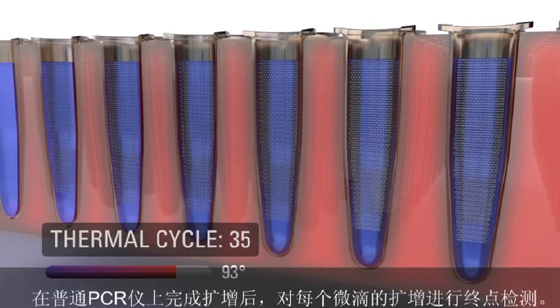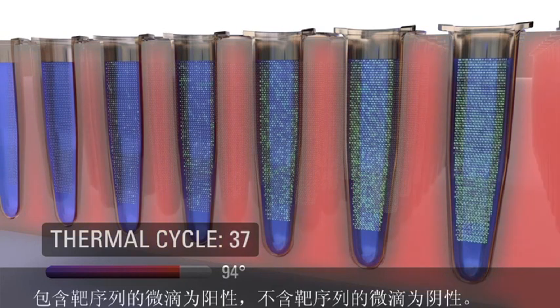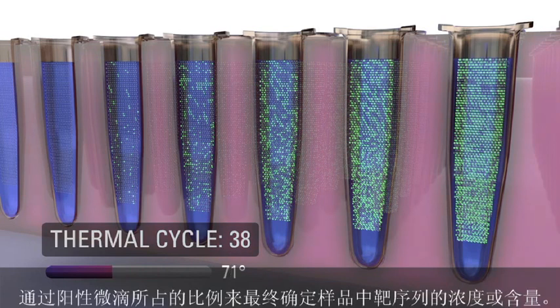To generate digital results, samples are amplified to endpoint in a conventional thermal cycler. Droplets that contain the target DNA sequence are read as positive. Those that do not are read as negative. The fraction of positive droplets determines the concentration of the target DNA sequence in the sample.